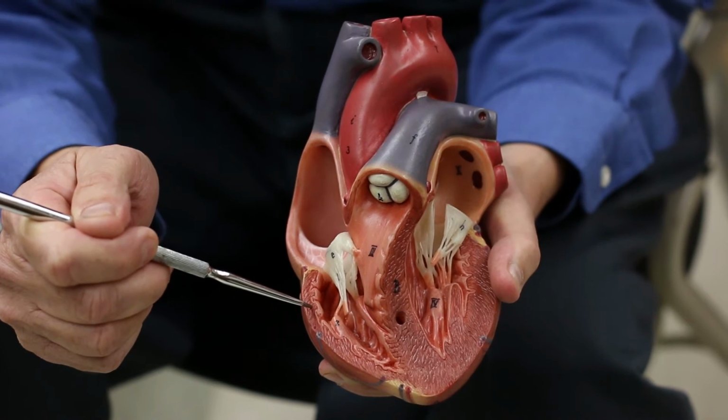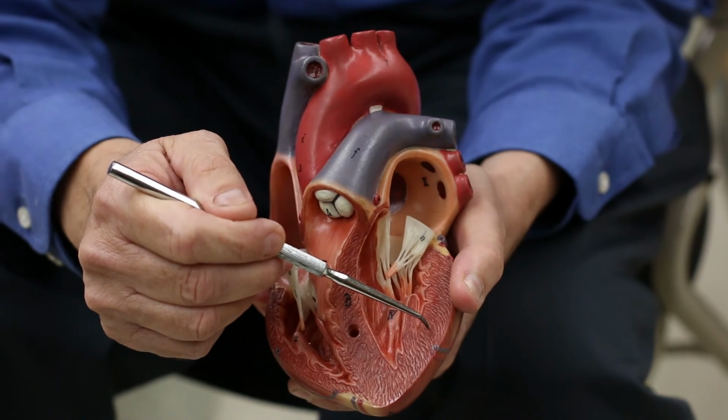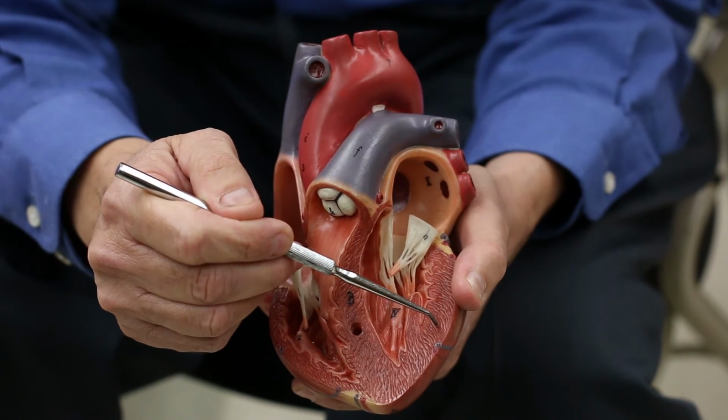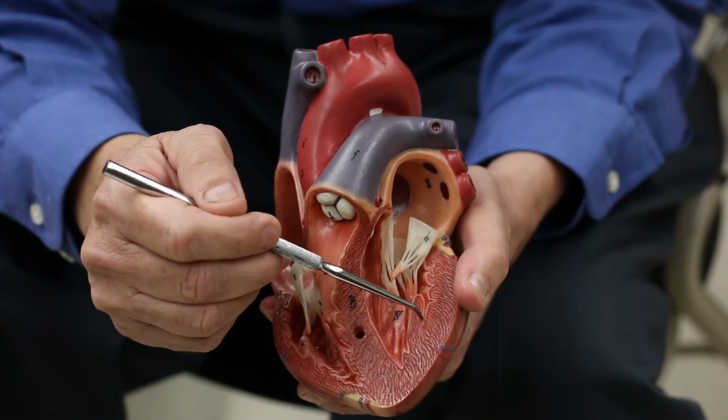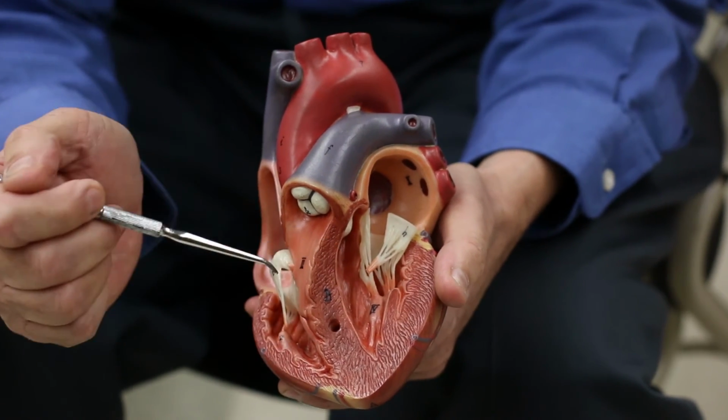And that just has to do with the amount of work they have to do. This ventricle only pumps to the lungs and back. This ventricle has to pump blood throughout the body, to the top of the head and down to the bottom of the toe. So it needs to do a lot more work. It needs more muscle power to do that, and that's why it has much thicker walls.